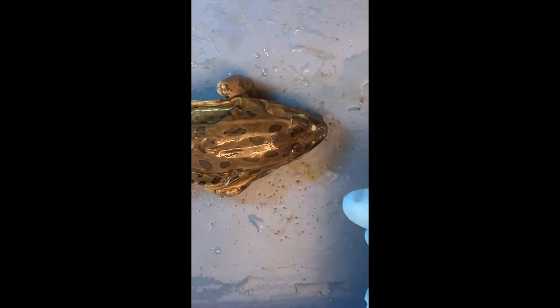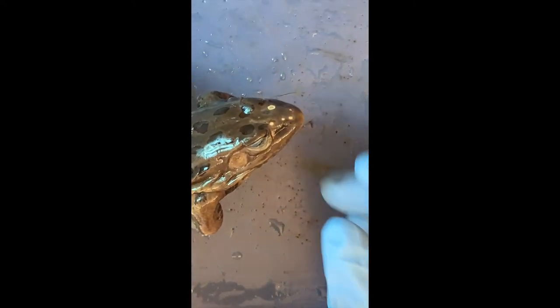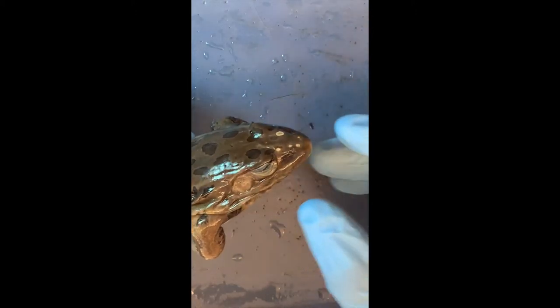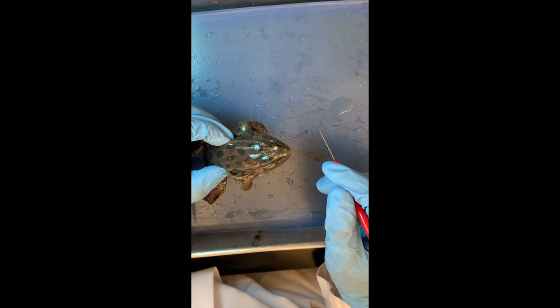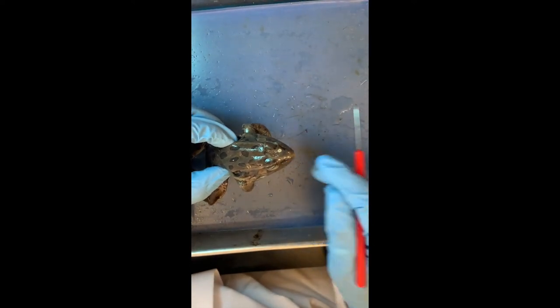How does this thing see, eat, and smell? They see with their eyes — they see pretty well, but here the eyes are closed. They have a little nose with nostrils, nares here. And they like to eat bugs. Some frogs, when they're big, can even eat mice. They react to everything that moves and try to catch it.